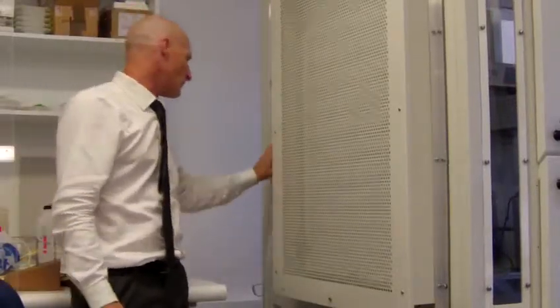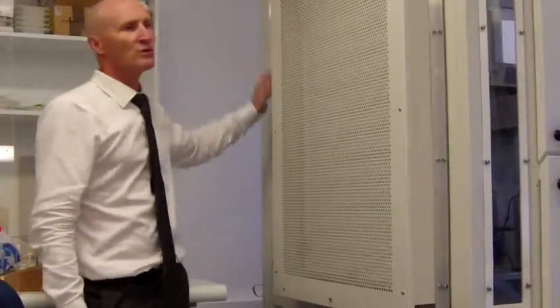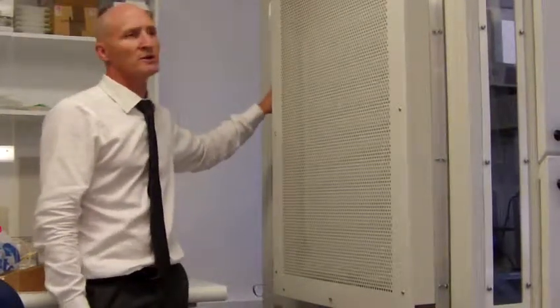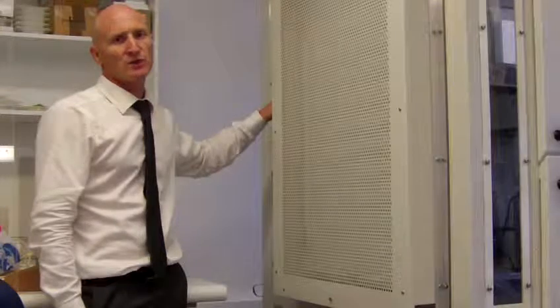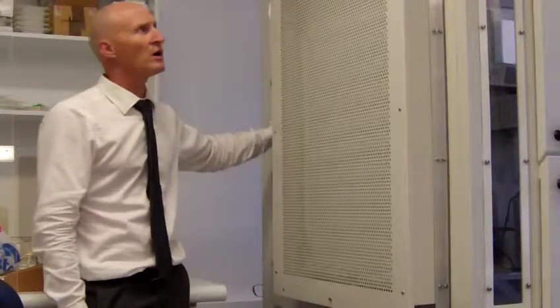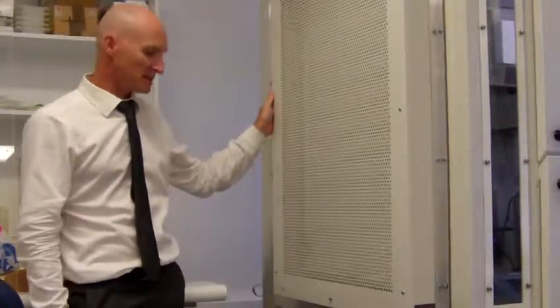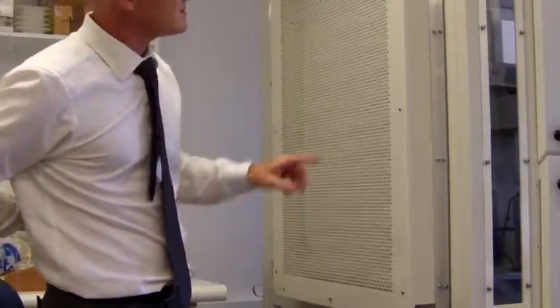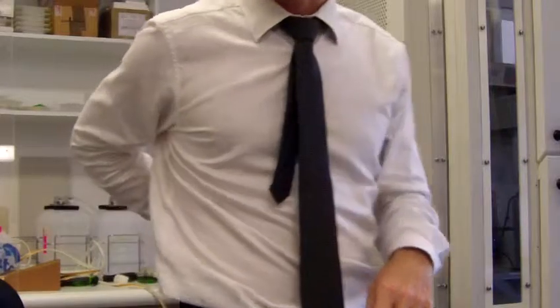and we'll go through then how I sealed up all of the hood inside, and also the actual perspex panels, which are not sealed at all on the Bigneat as it stands. So firstly, I'll take you through how I made the mountings on here and did the sealing on the perspex framework.